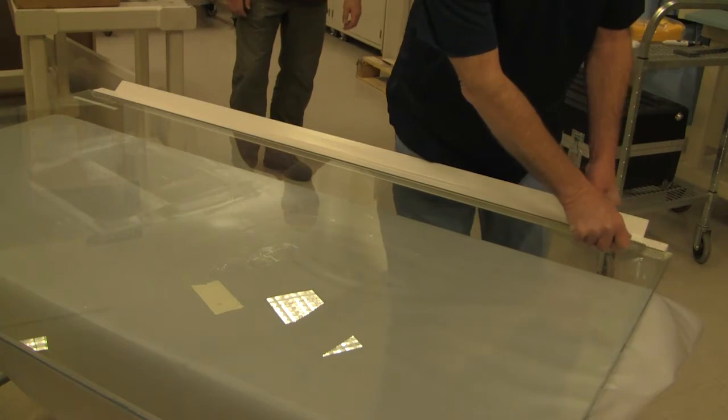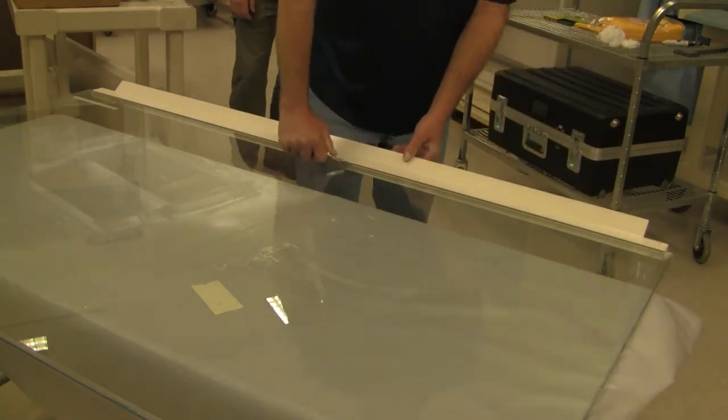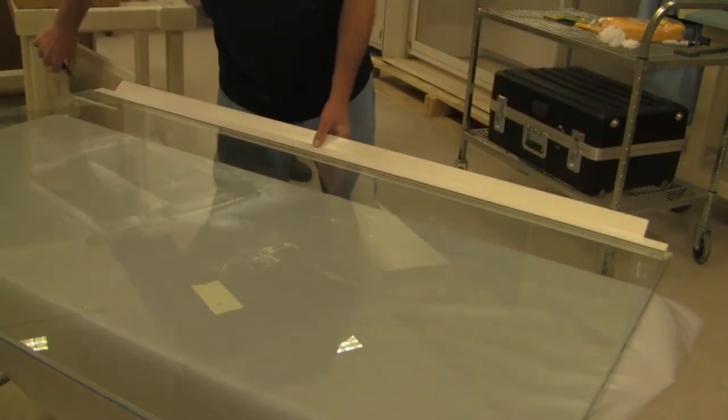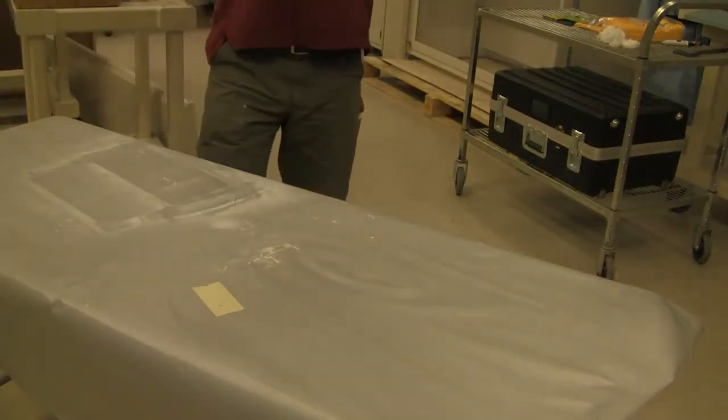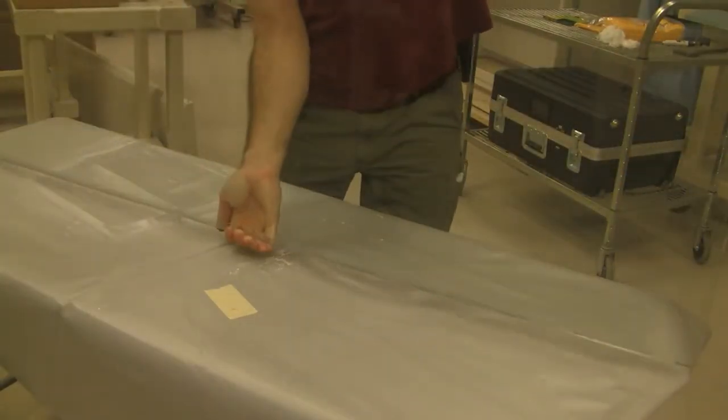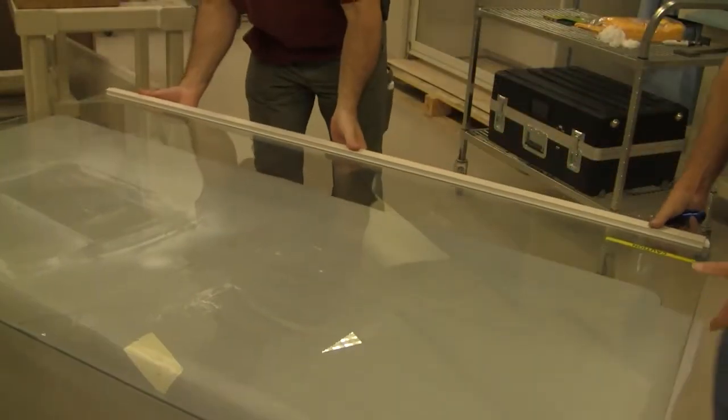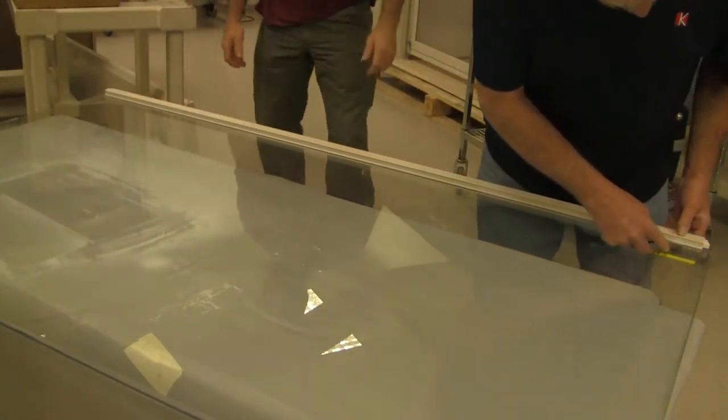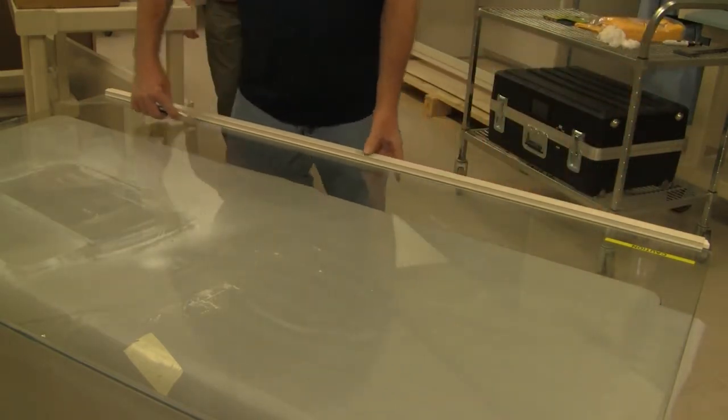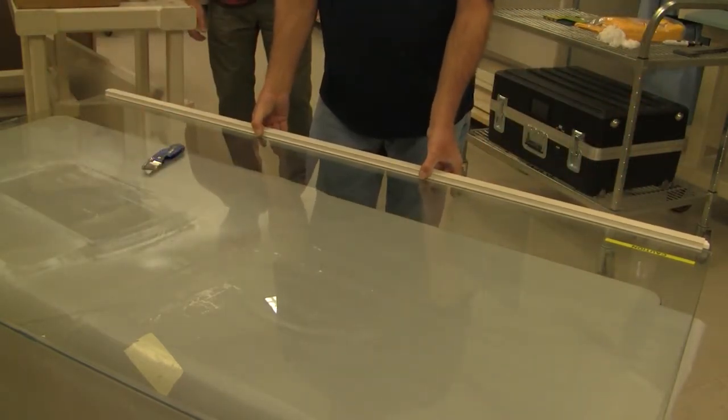Run a utility knife down the sides of the sash handle to free the glass from the silicone. Wiggle the handle to free it from the glass.